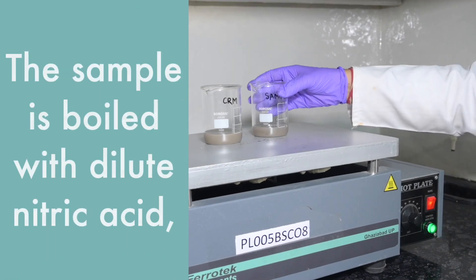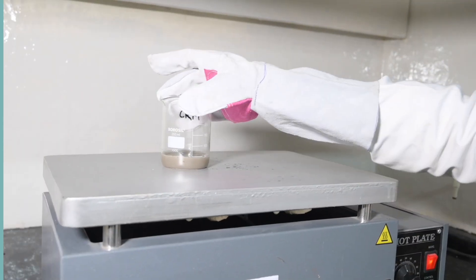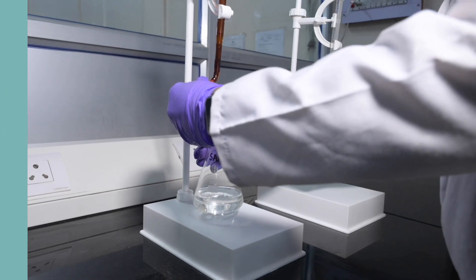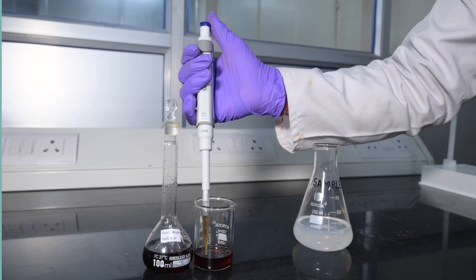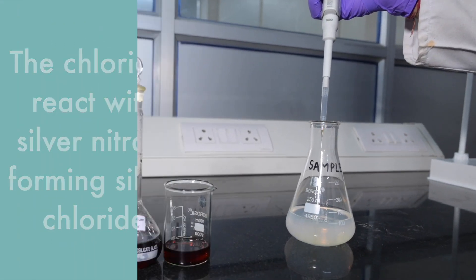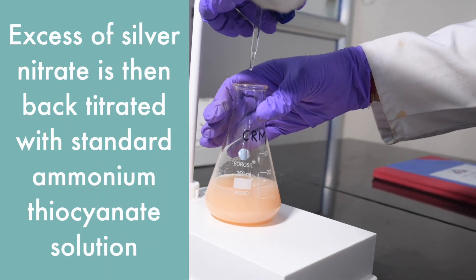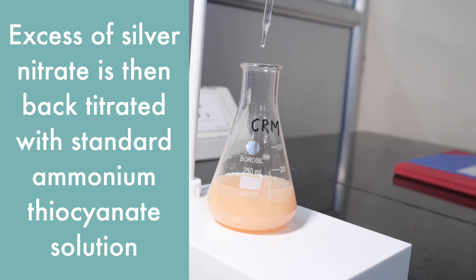First of all, the sample is boiled with dilute nitric acid, thereby dissolving all the chlorides present. Excess standard silver nitrate is added to it. The chlorides react with silver nitrate forming silver chloride. Excess silver nitrate is then back titrated with standard ammonium thiocyanate solution.